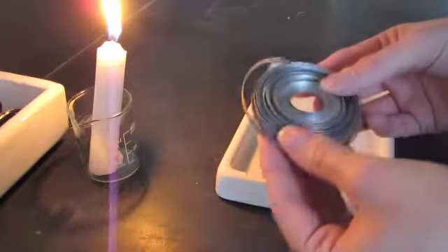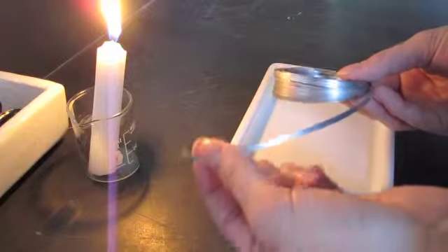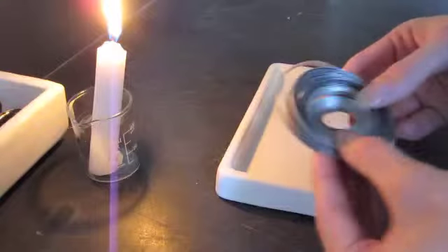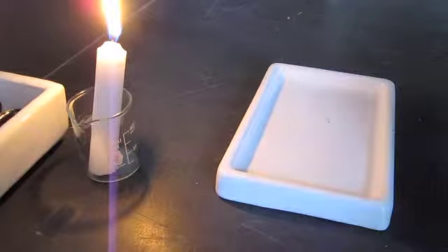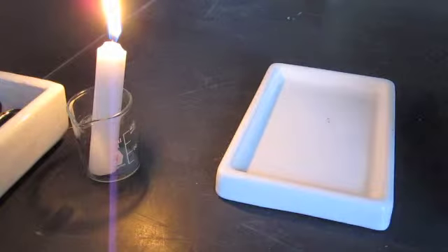All right, so here we have some elemental magnesium. This is just magnesium ribbon. And we're going to react it with the oxygen gas in the air in order to produce magnesium oxide.